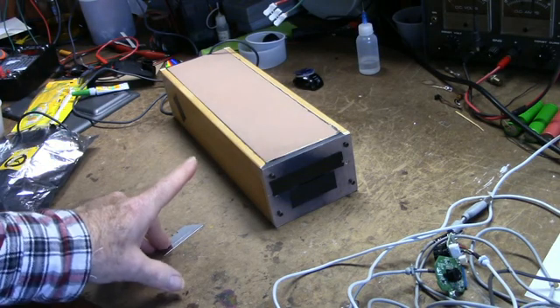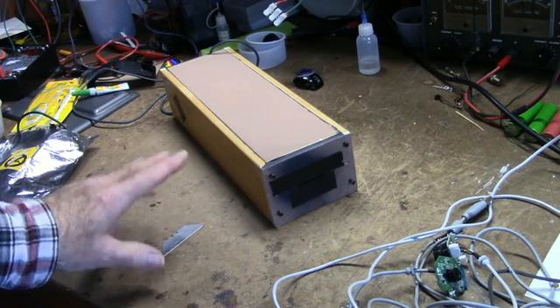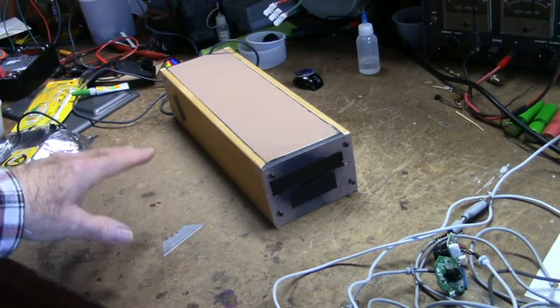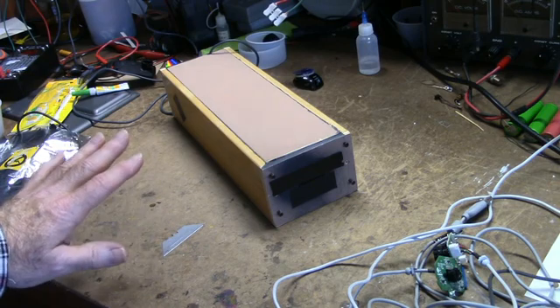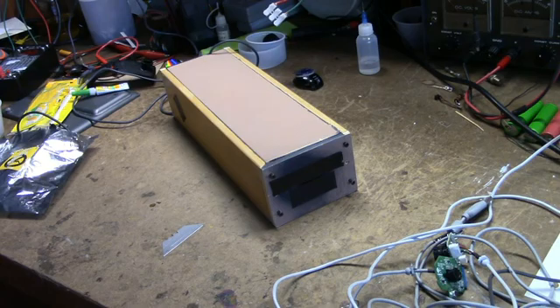Now the inside of this enclosure should be painted flat black, an ultra flat black, to help absorb any light. It has to be sealed. Any light that gets in is going to cause problems here. I used to use Krylon ultra flat black, which is really good, and unfortunately I don't think they make it anymore, but here's what I found that works perfect.